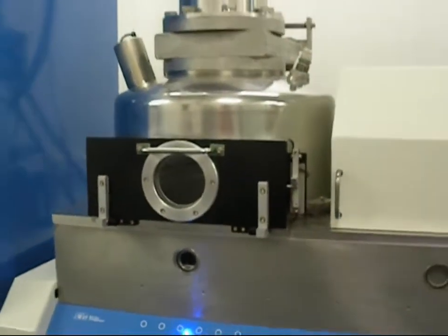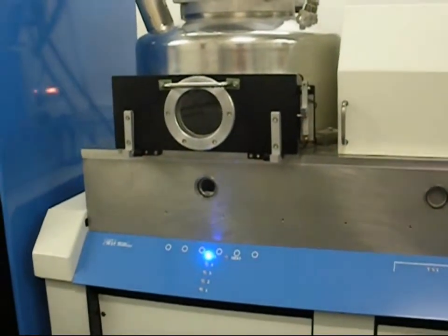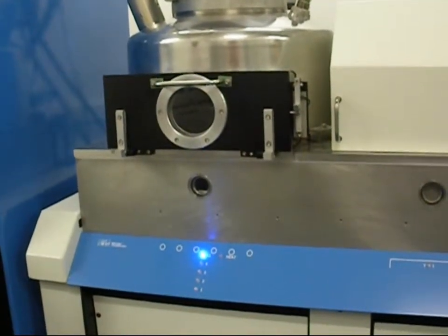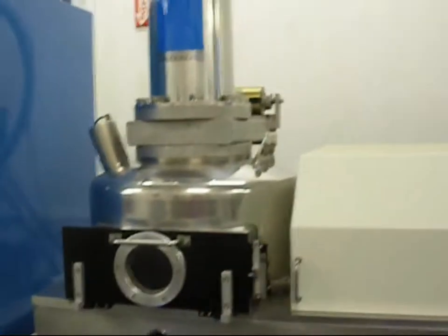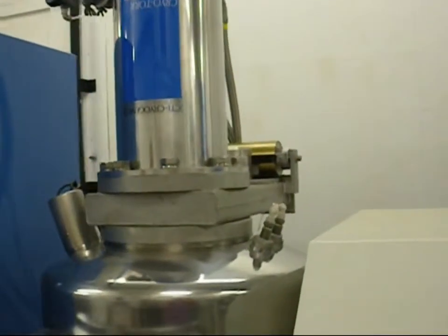After the initial roughing set point is met, the high vac pneumatic gate valve will open and begin the high vac pumping sequence of the load lock chamber. High vac pumping is accomplished by a dedicated CTI-8 cryo pump to a second pre-programmed high vacuum level set point.